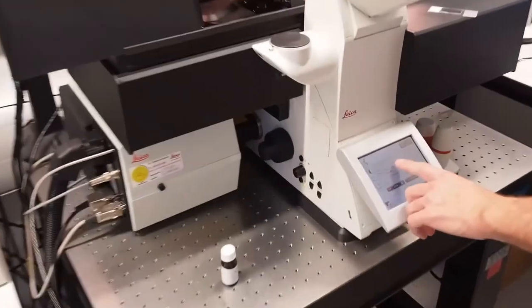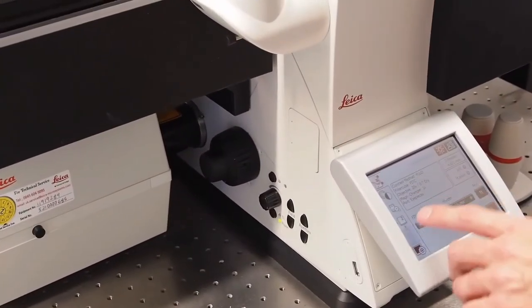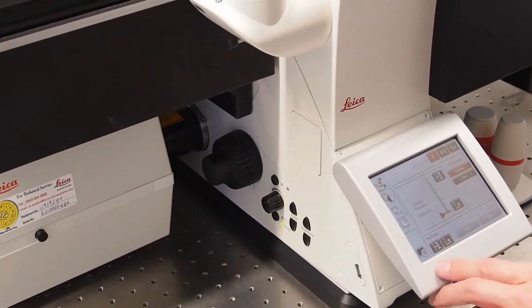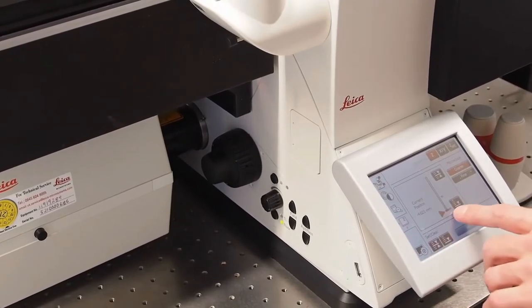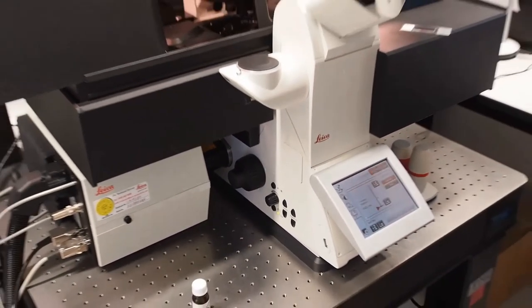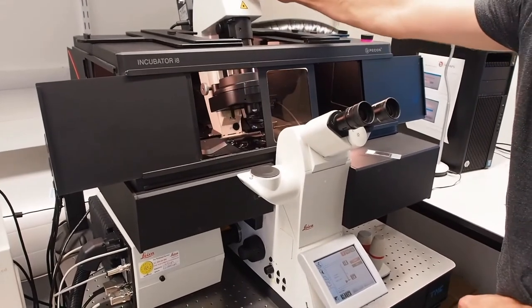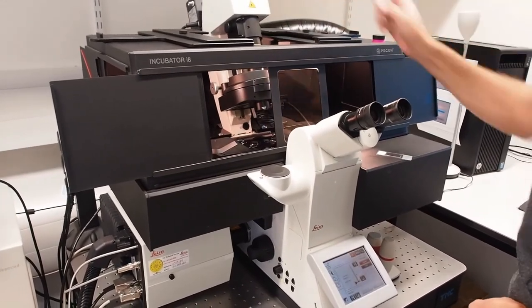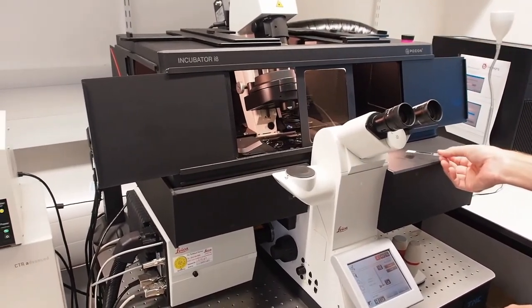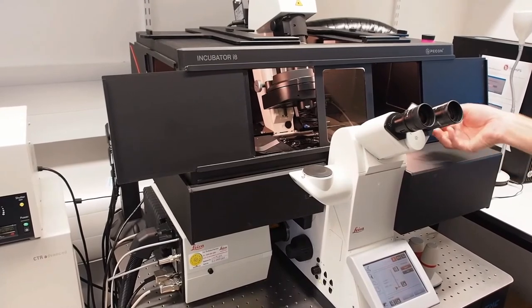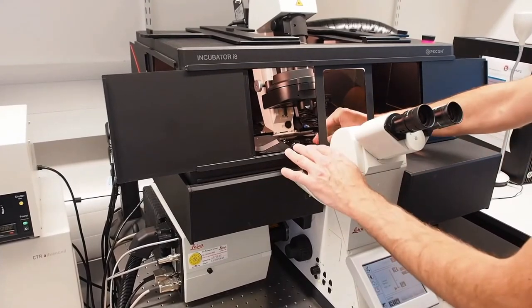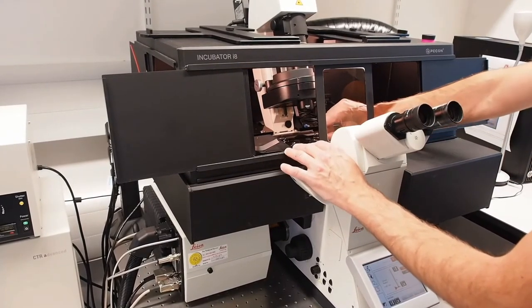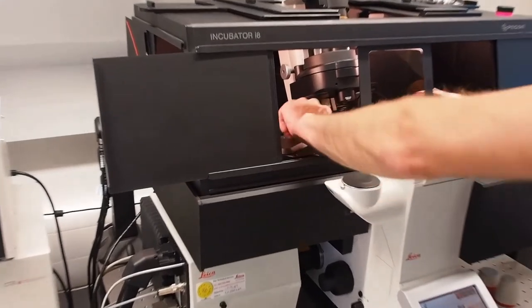On the touch screen observe the objective, it is a dry 20 times lens. Press the XYZ and make sure that the red arrow is at the bottom. Let's bring the condenser back and carefully place a slide on the stage, cover slip facing down. Make sure the slide is securely in place with the slide clips.